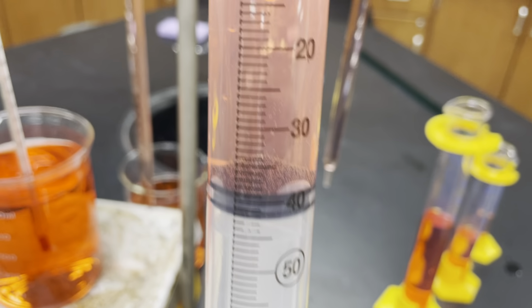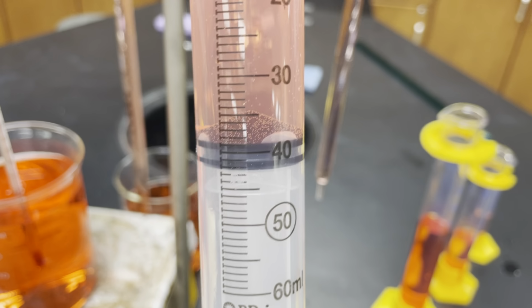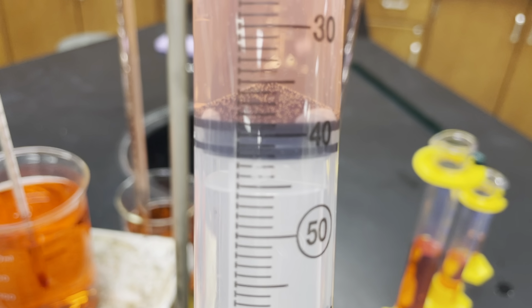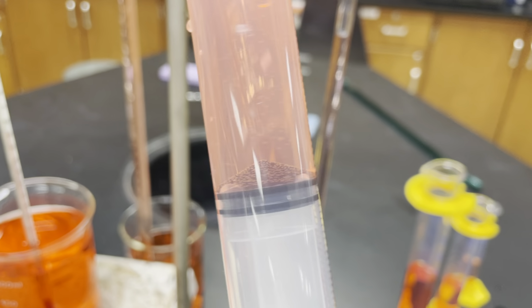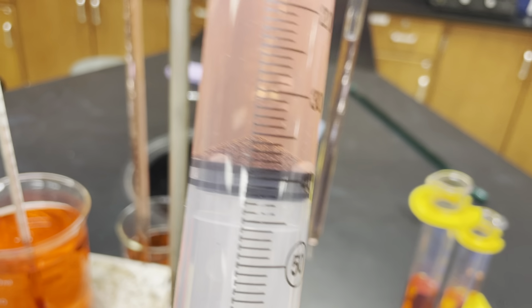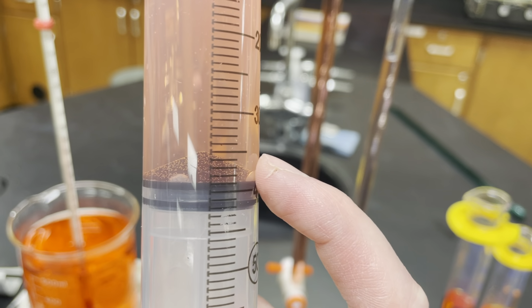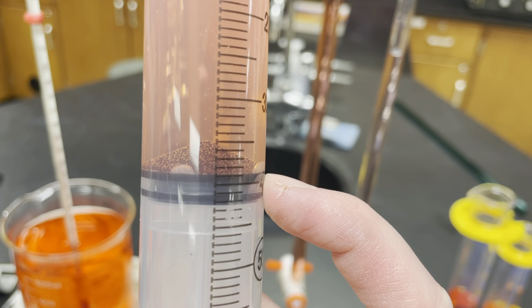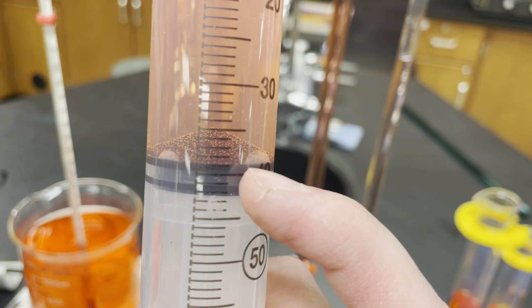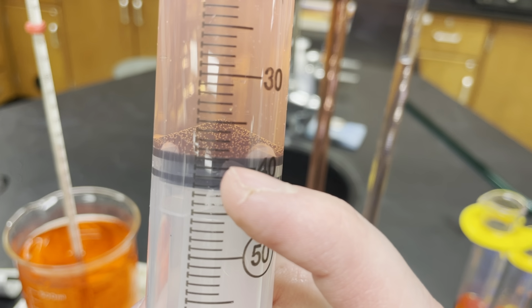Now, do we count where the tip of that rubber is right there? Or do we count on this black flat line here? Or do we count on this black flat line below it? Well, it doesn't really say on here if you turn it around. What I would say is going by this kind of black line at the end of the rubber, but not on the tip of it. That's a point that we can tell for sure lines up somewhere on the syringe. It's probably kind of measured to be there purposefully. So this one looks like it's sitting right about on 39.